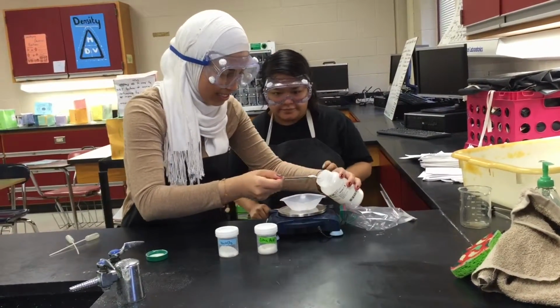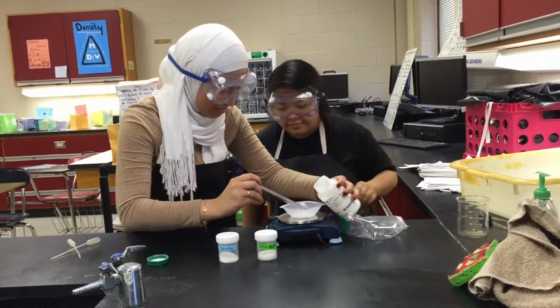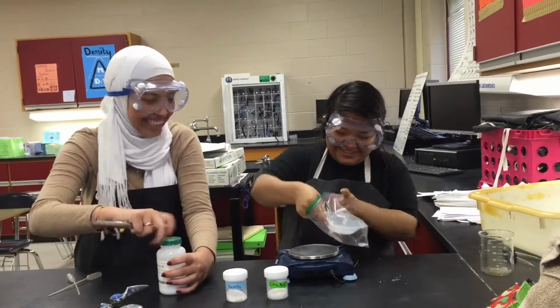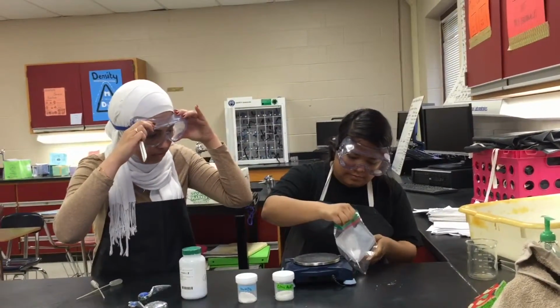Calcium chloride. Make sure you're careful in not mixing the substances.